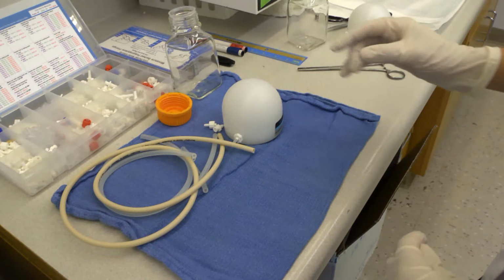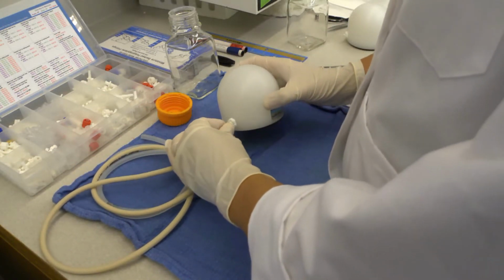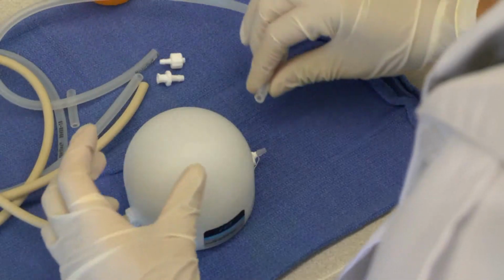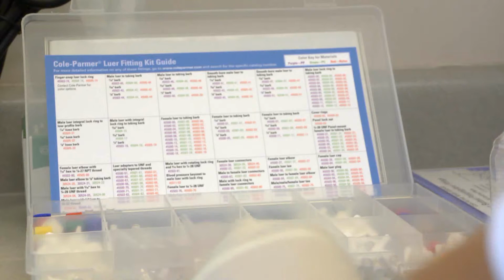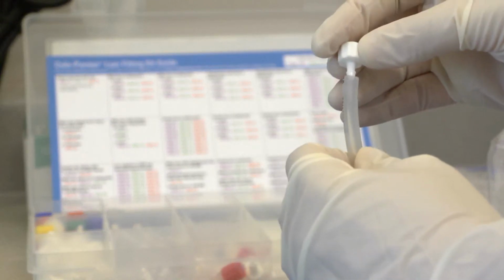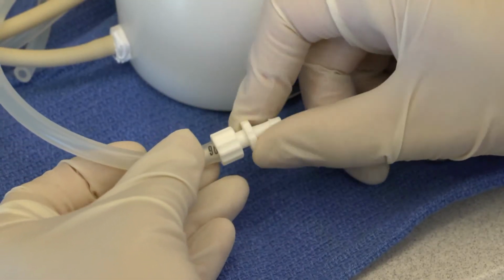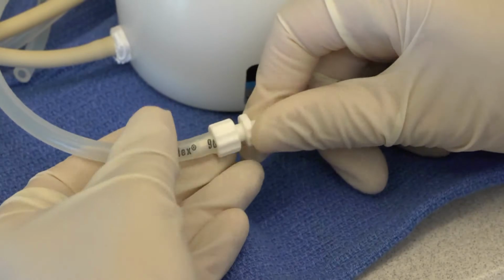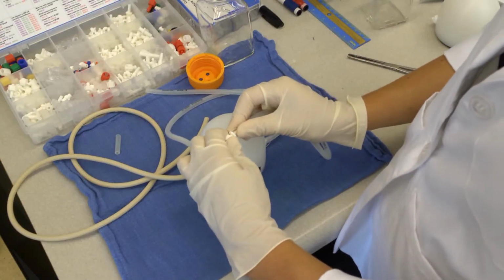To assemble the flow circuit, start by attaching a 36-inch segment of hard tubing to one end of a pulse dampener. To the other end, attach an 18-inch segment of soft tubing. Place a 1/8-inch male Luer adapter at the end of the 18-inch soft tubing section. Connect the male Luer to a 1/8-inch female Luer adapter. Attach the female Luer to a new 18-inch segment of soft tubing.